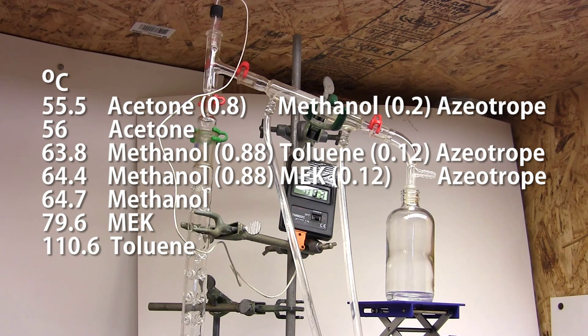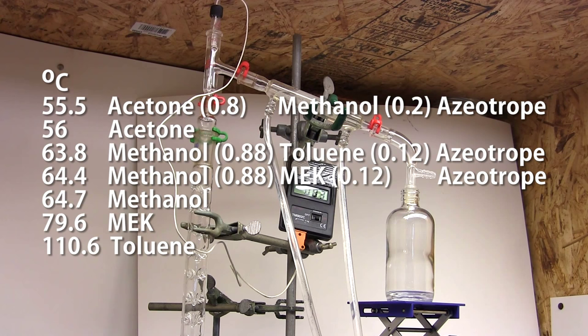Eh, looks like we're moving past the boiling point of methyl ethyl ketone which should be around 79 degrees celsius. Perhaps I'm heating too much and overloading the column with vapor. I'm going to turn down the heat just a bit to slow down the distillation.